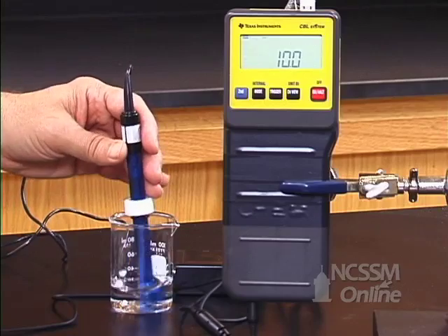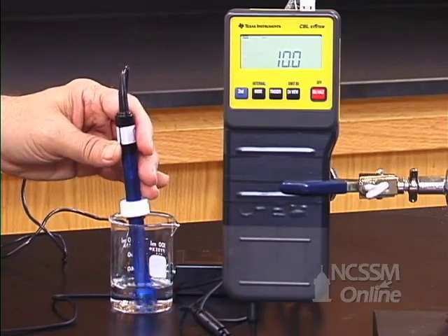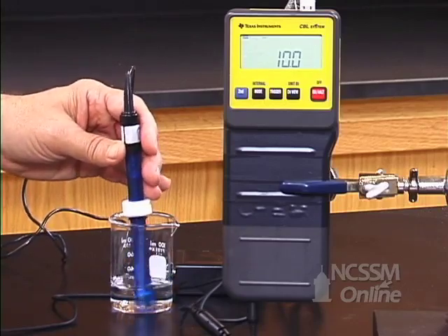After about 30 drops, the pH has started to rise significantly.